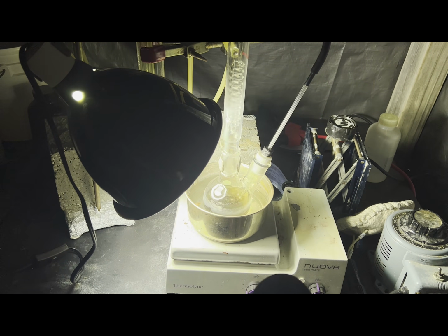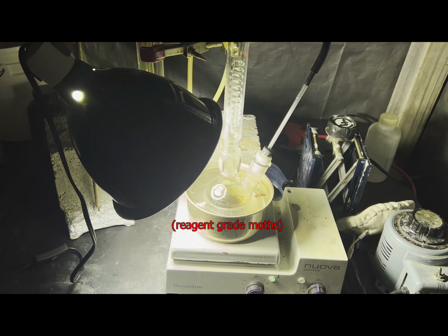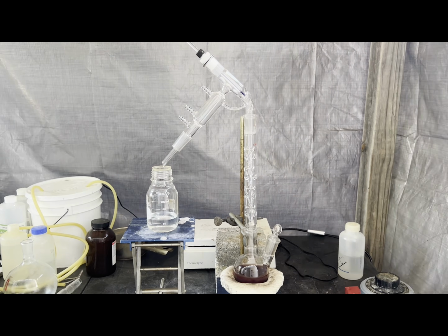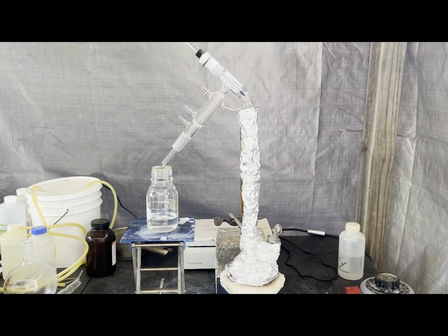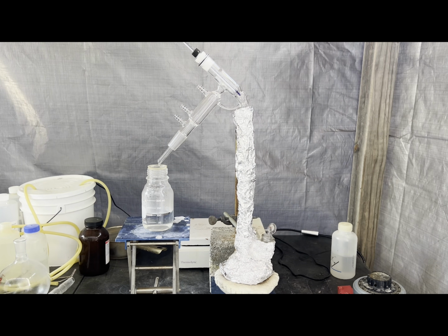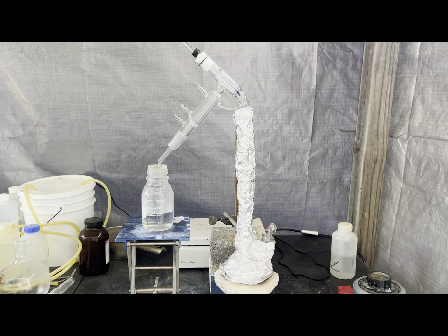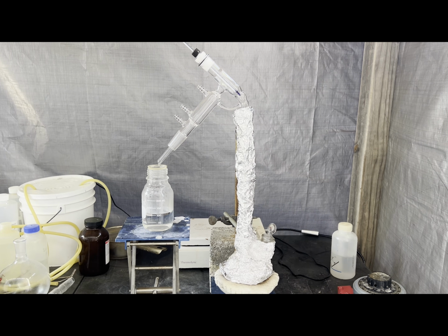After it cooled down, I stoppered the condenser and let the reaction mixture sit overnight. Then I set up for a short path fractional distillation. Chloroacetic acid boils at 189 degrees, so it was necessary to insulate the column and boiling flask with aluminum foil. An air-cooled condenser was used because chloroacetic acid is a solid at room temperature with a melting point of 63 degrees. I'm using the same bottle from my trial run of the reaction to collect the unreacted acetic acid fraction.